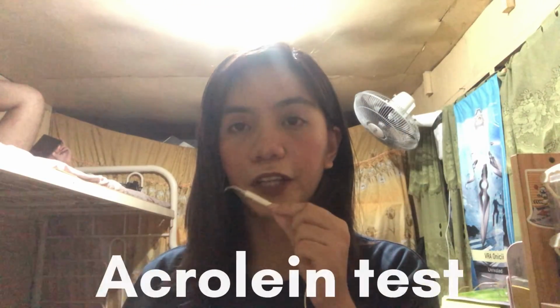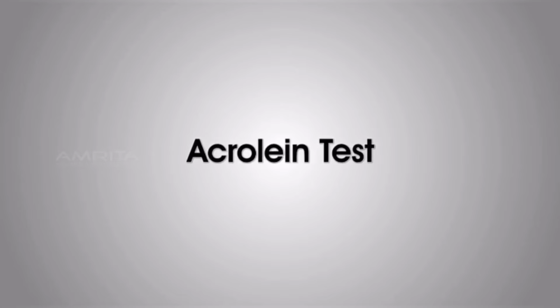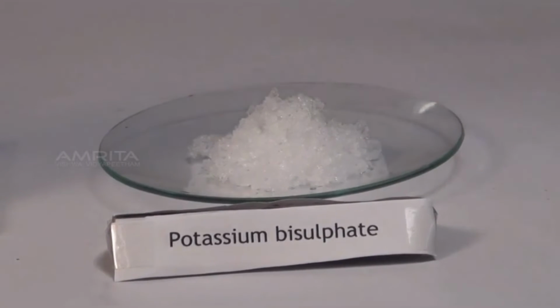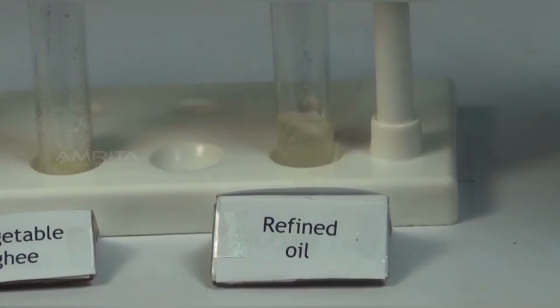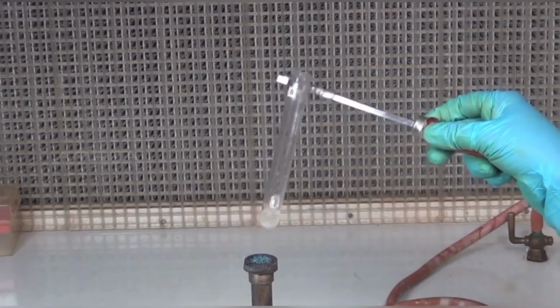Last, we have the acrolein test. In this experiment, we will be detecting glycerol and fat. Acrolein test. Take a small quantity of desi ghee, vegetable ghee and refined oil in 3 test tubes A, B and C respectively. Using a spatula, add a small quantity of potassium bisulfate crystals into test tubes A, B and C. Now, heat each test tube over the Bunsen burner.